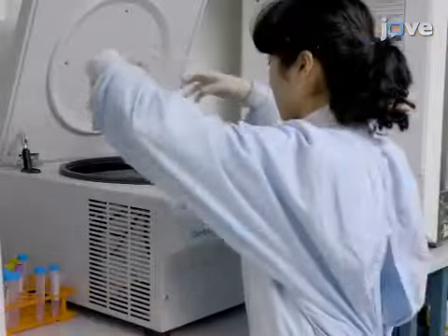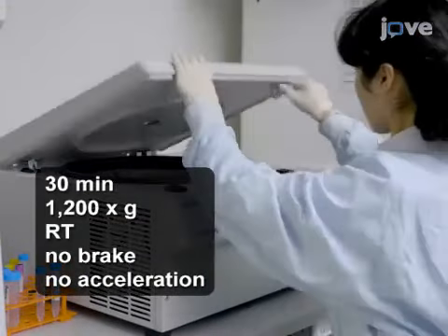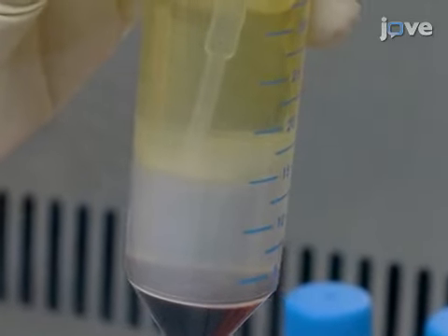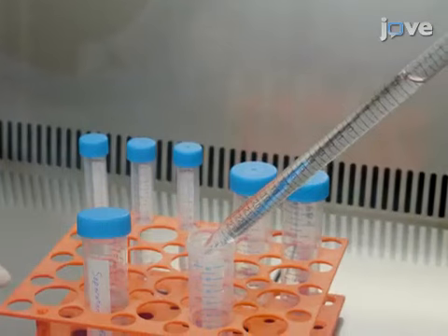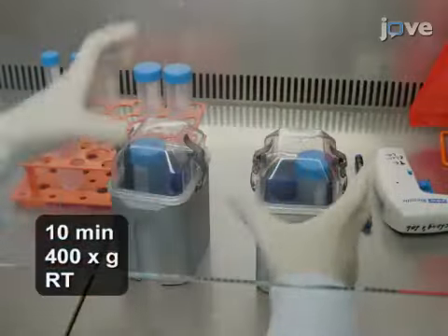Separate the cells by density gradient centrifugation, then at the end of the spin, carefully collect 5 to 10 ml of mononuclear cell-containing buffy coat layer into one new tube per sample. Bring the total volume in each tube up to 50 ml with fresh separation buffer, and centrifuge the cells again.